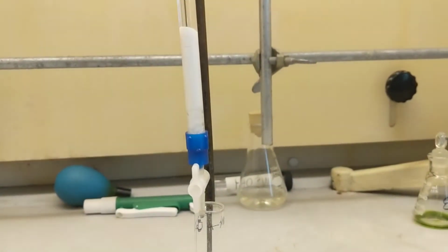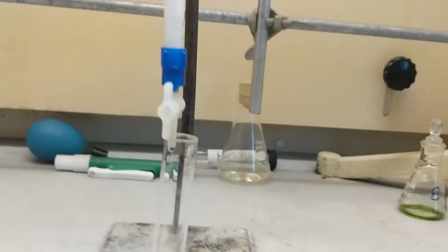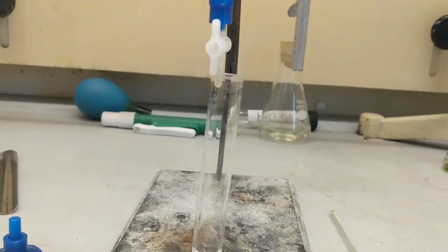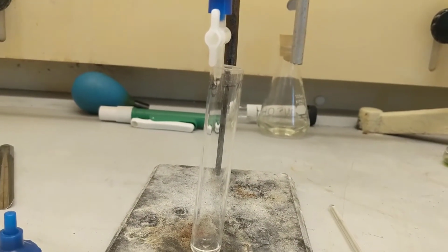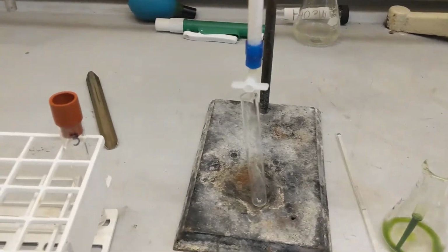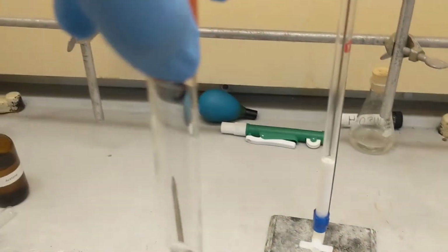But I'm just gonna let this get to the top of the alumina, close it up at the top, and then I'm gonna add half of my extract. Yep. Alright, see you guys when that reaches the top of the alumina. Slowly and painfully pulled out the hexane. You can see I have it sitting just at the top of the alumina.